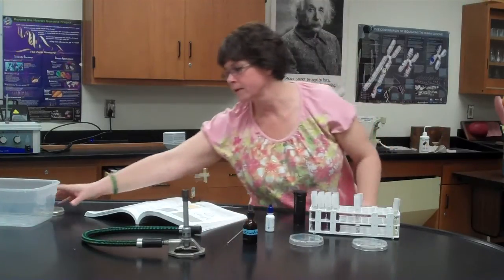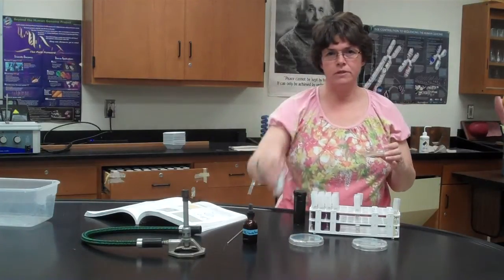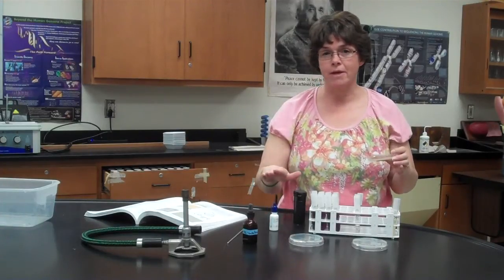Now the specimen, they're gonna be on plates, okay? So when you take your loop full from the plate, make sure that you're gentle and you don't gouge up any agar. You need just 1 small colony, not even a whole colony, to make a wet mount, because if you get too much in there, it's going to end up being all clumped together and you're not going to be able to see the cells. So like we've done before, less is more. Just basically touch the colony and then spread it into the lactophenol cotton blue, and then put your cover slip on. It's a wet mount. You're not making an actual smear, okay?